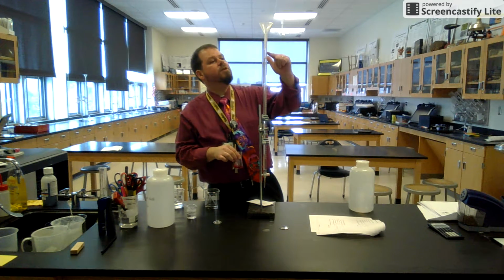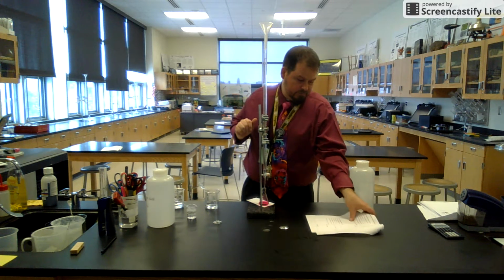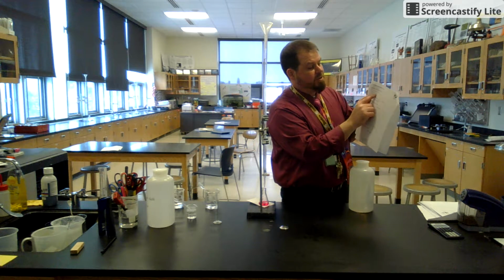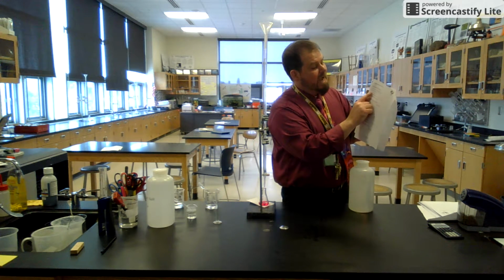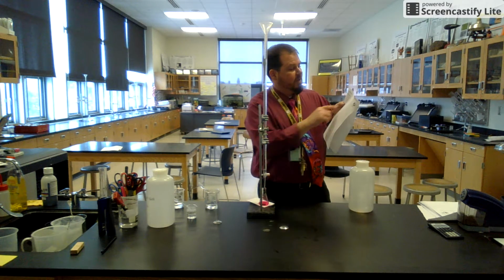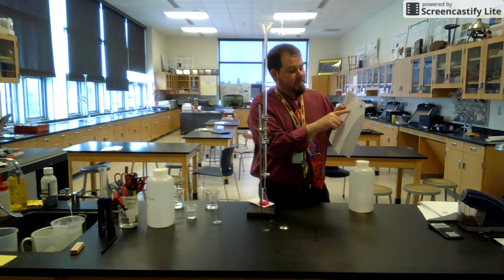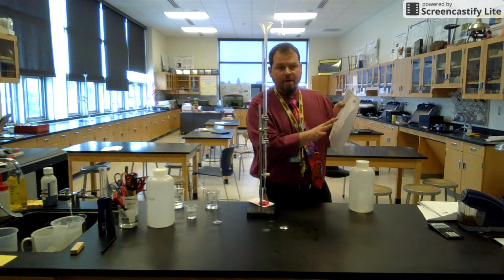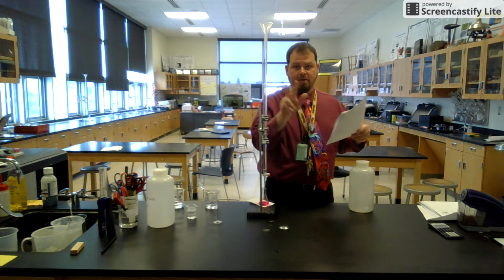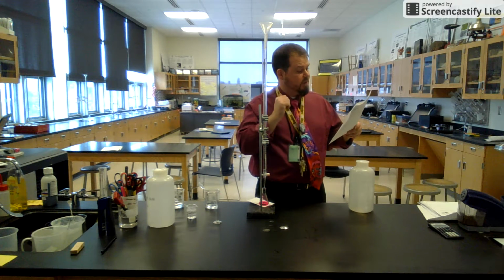You also need to note at the end of each trial what the new volume of the base is. So back to this trial. I know I put 10 mils of acid in. I had an initial reading of my burette, which was 0. I have a final reading of my burette when I'm done and I'm happy that I've titrated this properly. And that's what I need. Then I can figure out what the total volume is, which is the final minus the initial, and I'm off to the races as far as calculating concentration of my acid. It's plug and chug from there. I'll know all 3 values I need. I got volume, I got concentration, solving for the other concentration.